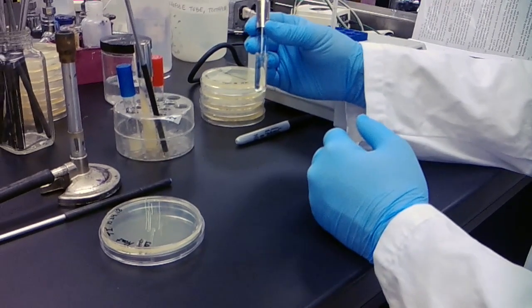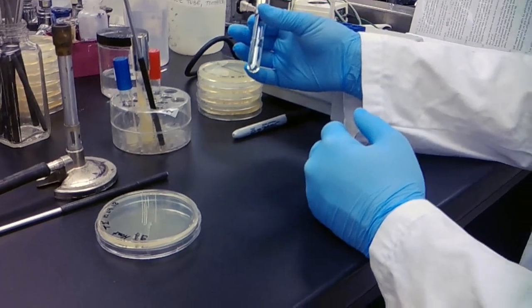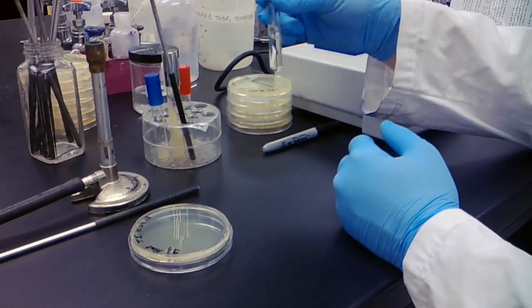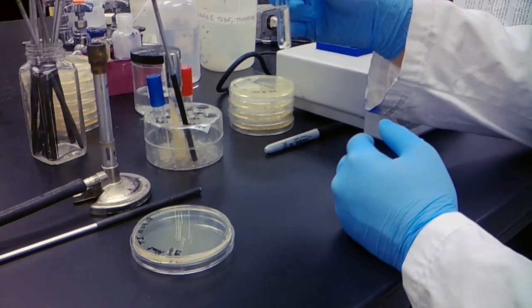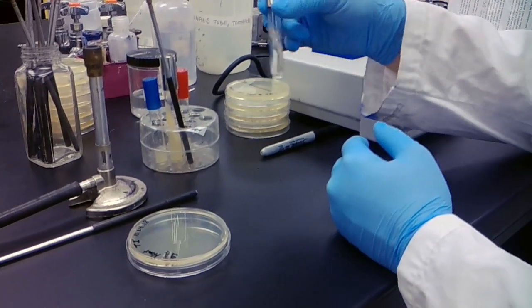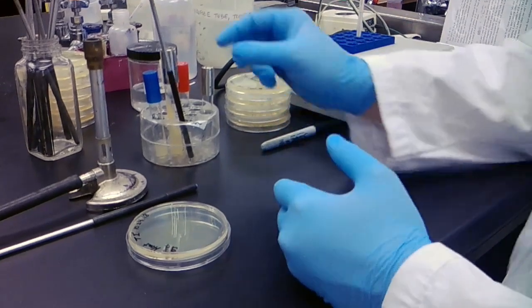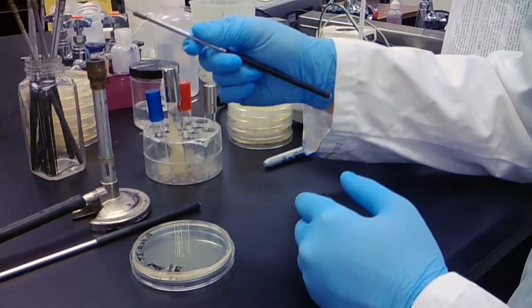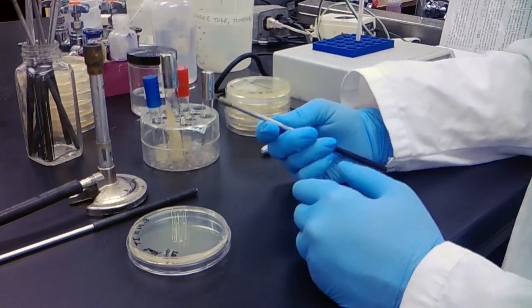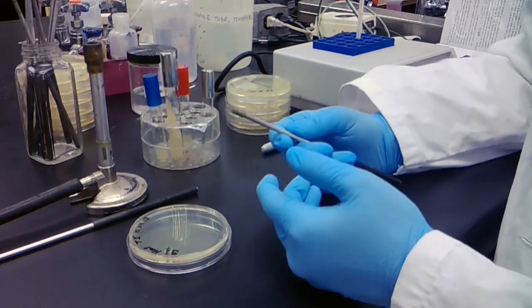Now that it's been a minute, I removed my culture from my hot plate. Again, like I did with time point zero, I want to mix this up a little bit just to mix the growth, make sure that I have my sterile loop, and then we're going to spread this to isolation.